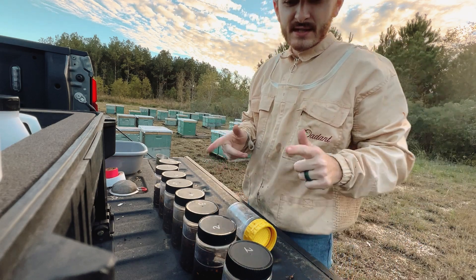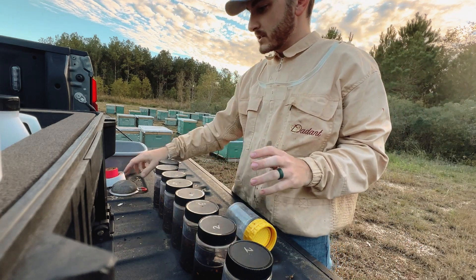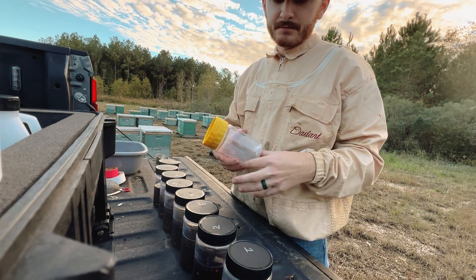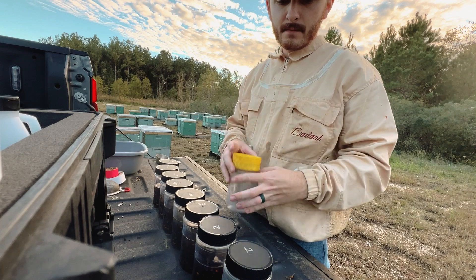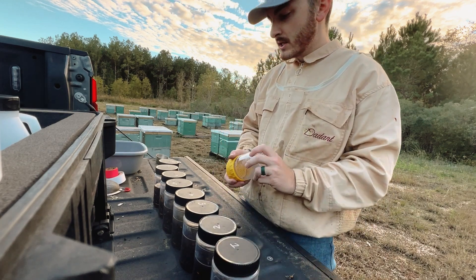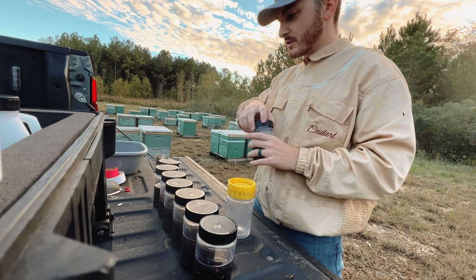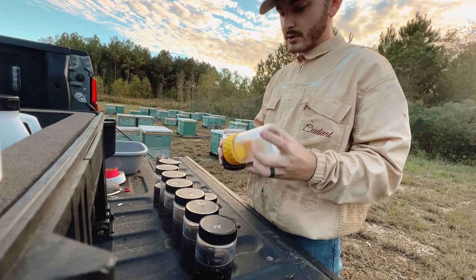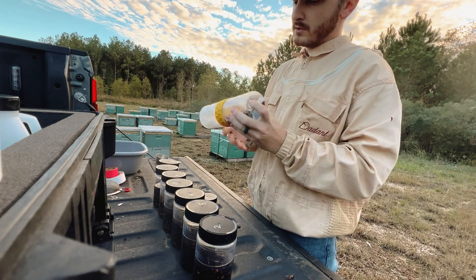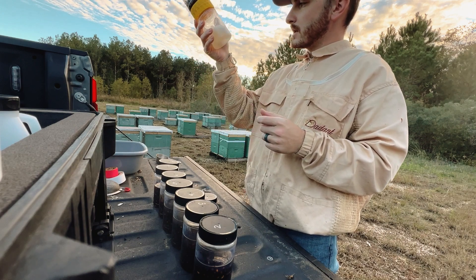Okay, so I shook the samples and now we're gonna process them in real time. All we need is this jarfilter.com screen. I just shook these — probably saw that — so what I'm gonna do is just process the samples quickly. We're gonna go first one, give it a little bit of a shake, let it drain.